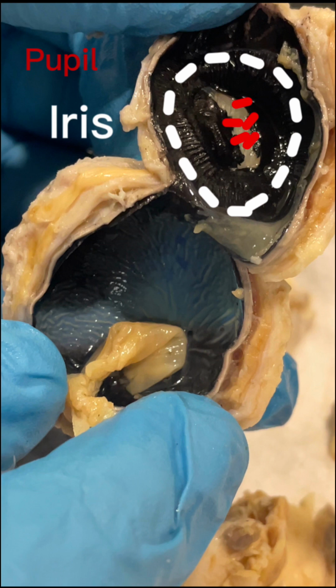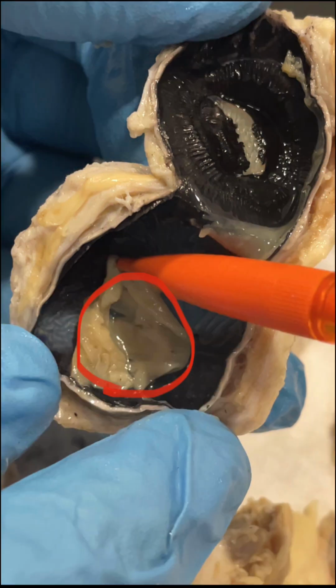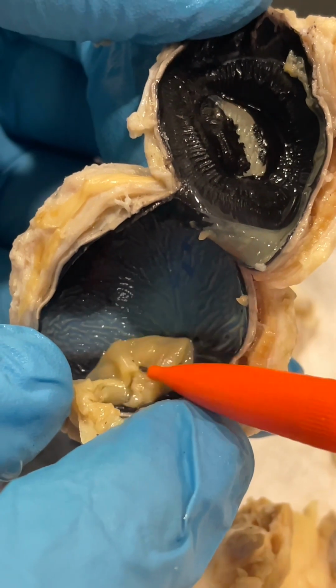The change in size helps you see in different lighting. The retina converts light that enters into your eye into electric signals. Your optic nerve sends them to your brain, which creates the images you see. It's a key part of your vision. The retina is the layer at the very back of your eyeball. This is the retina. Okay.